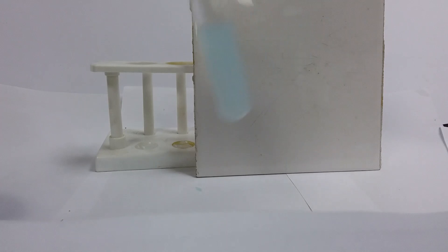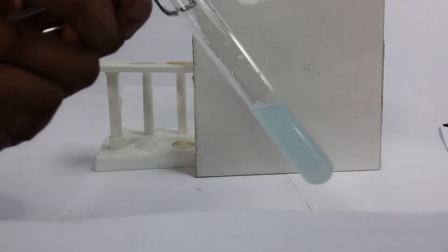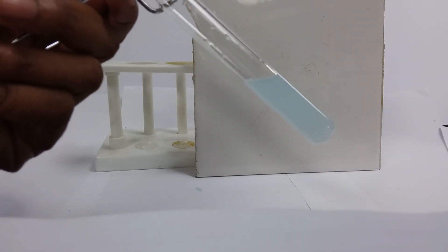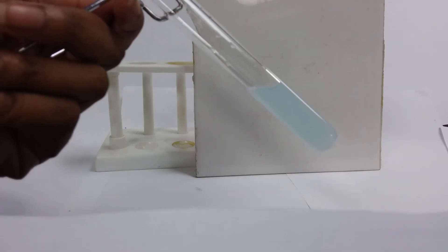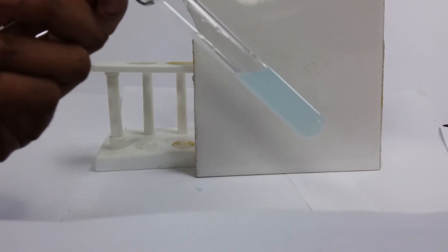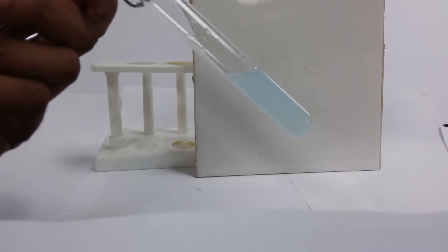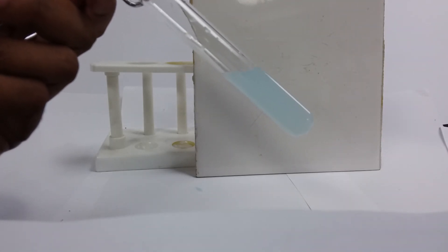So that ends our qualitative analysis. We have our two salts that we've tested using our major tests, and we should have some idea of what we are working with at this point. Thank you very much.